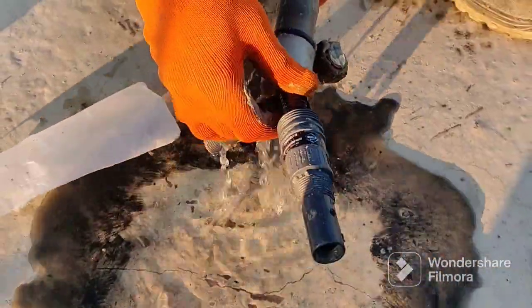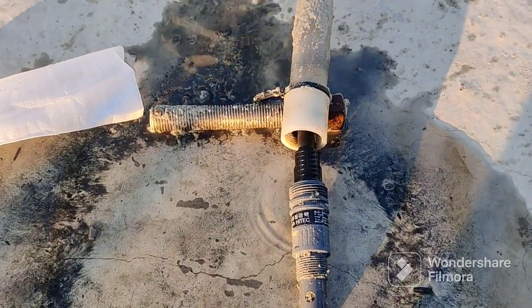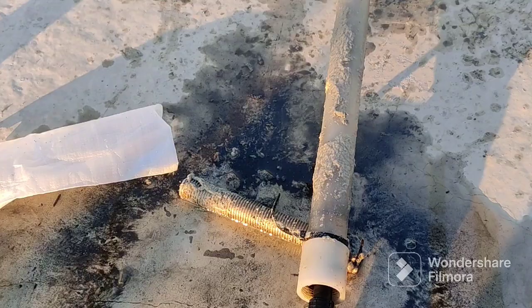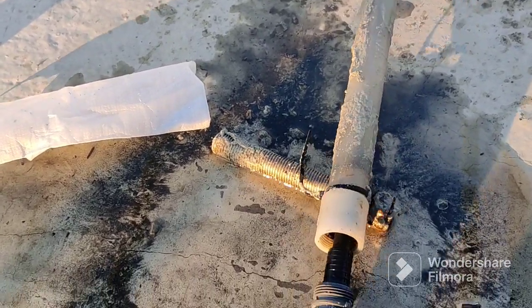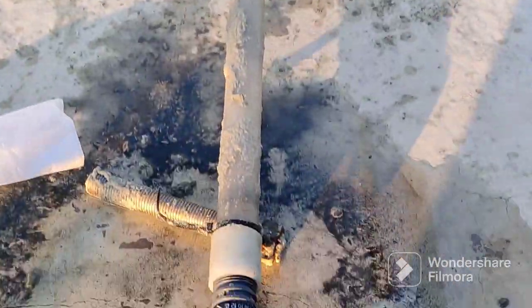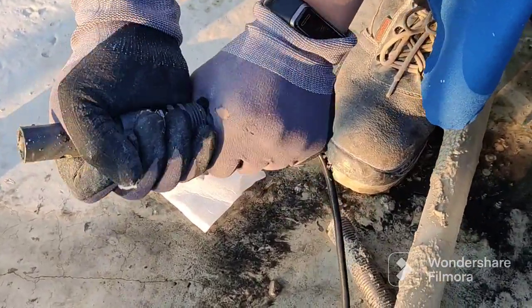Inside we put some water — this water is moving. We are putting water inside the pipe for stability because the pipe weight is not too much. You see this steel rod — one steel rod. This bolt will be connected to the pipe for weight to keep it down.